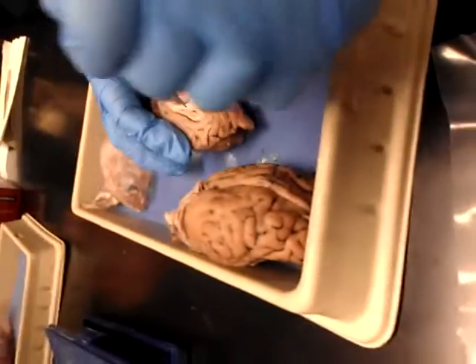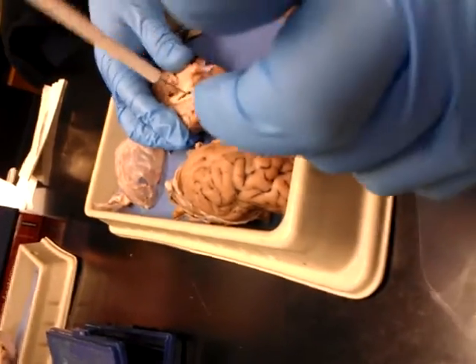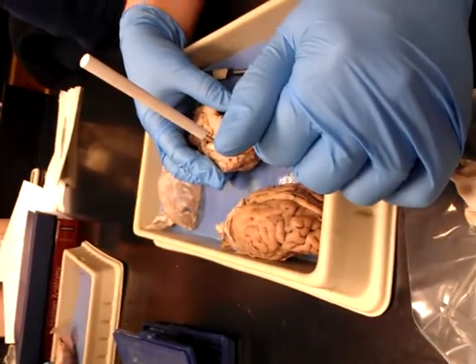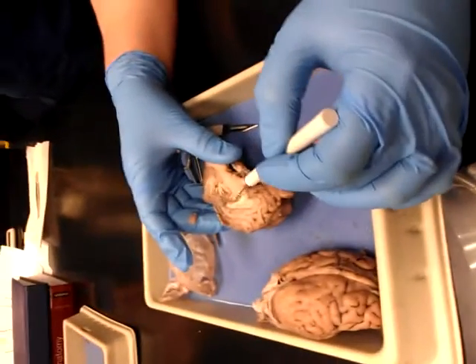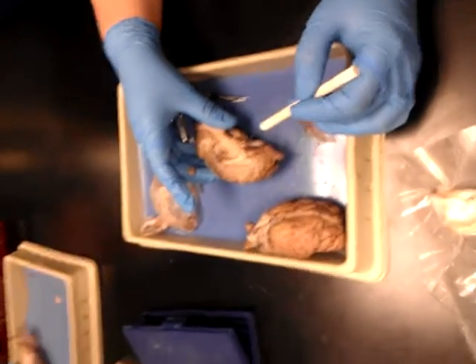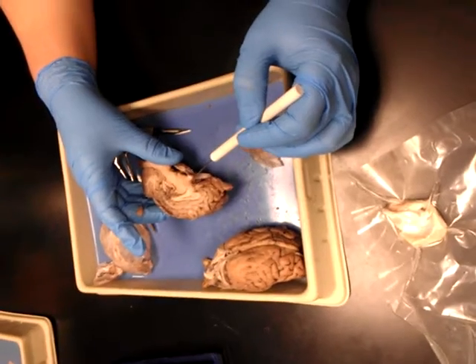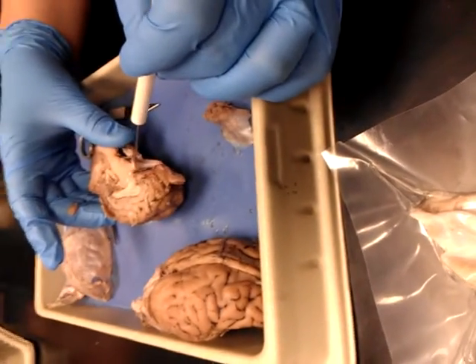See where I punctured it here — down in here, now that you've seen that, that's your lateral ventricle. So if it's sitting up and down, they want lateral ventricle. That nice round thing is your thalamus. Down here is hypothalamus, and then this is your optic chiasma, where you cut your optic nerves, right there at the bottom of the V in half. This is your optic chiasma.